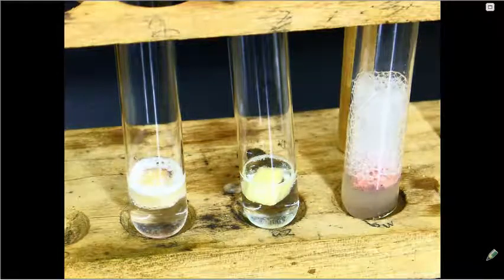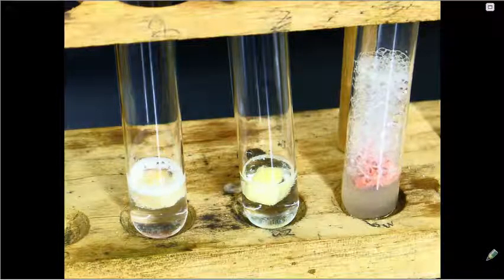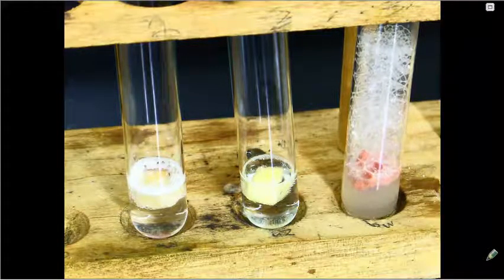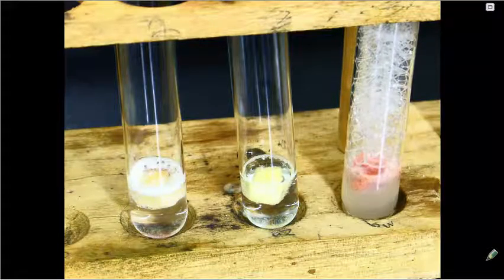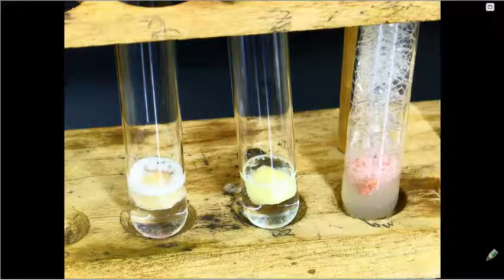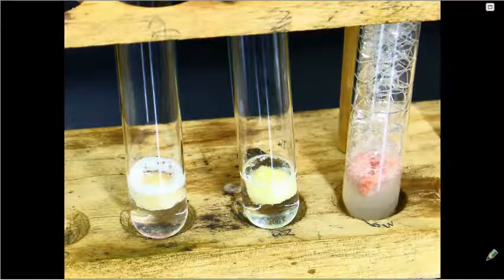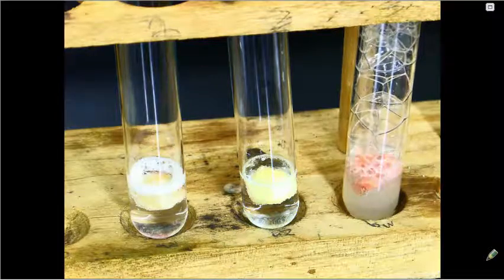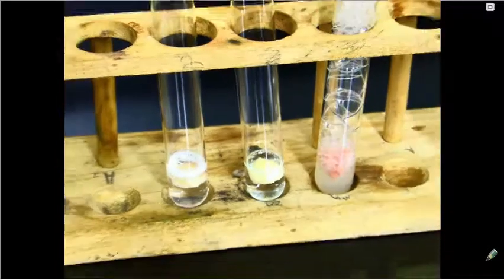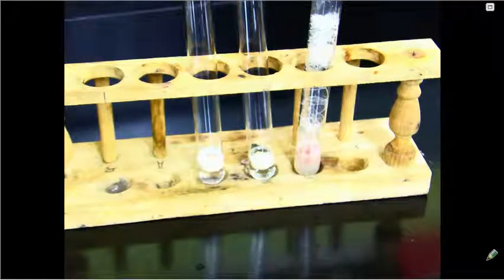Let's make observations of the relative rate of reactions. So potato is on the far left, apple is in the middle, and chicken is on the far right. Remember, catalase is the enzyme that is causing this reaction to take place. If a particular tissue has more catalase in it, it will be able to do the reaction much, much faster. And if I zoom out just a little bit, you can see just how much those bubbles are growing or expanding in the liver test tube.